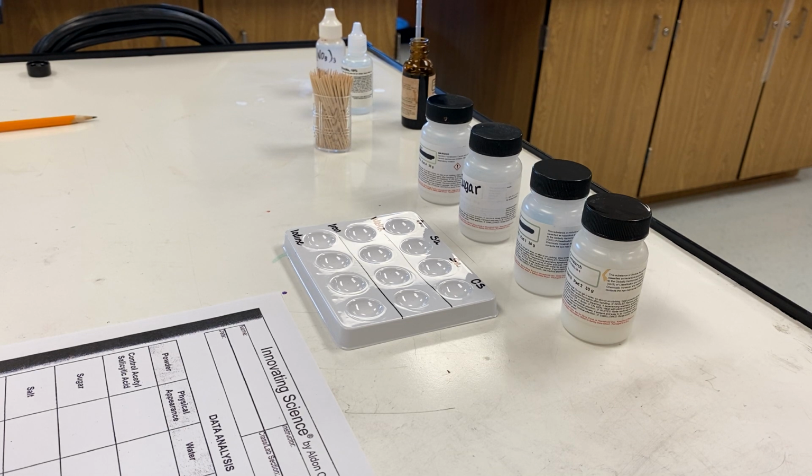Alarmed, investigators approached the cafeteria staff and asked what ingredients they used in the chili, particularly anything white and either crystal or powder-like that could resemble aspirin crystals. Cafeteria staff told investigators that beside the basic ingredients and spices that did not match the description, they do add salt for flavor, sugar to reduce acidity, and cornstarch as a thickening agent. Investigators have confiscated the sugar, cornstarch, and salt, and now they have been sent to you to test to see which one of them could have been tainted with the aspirin crystals, if any at all.